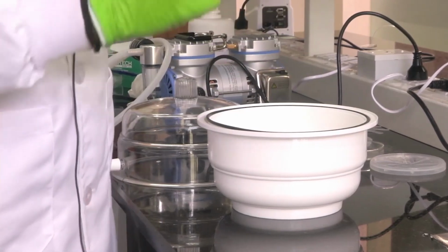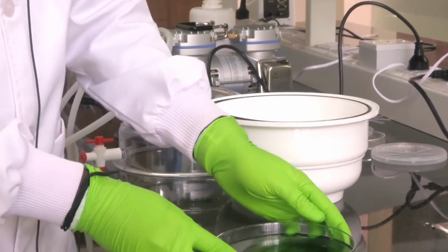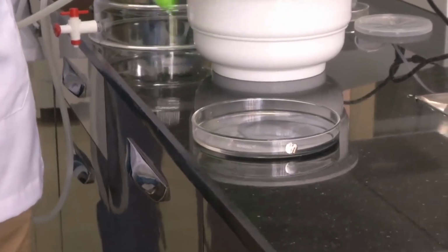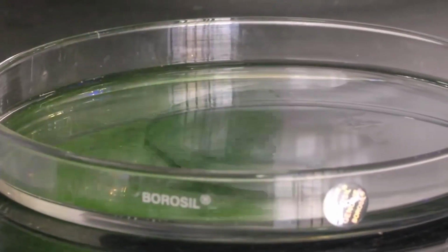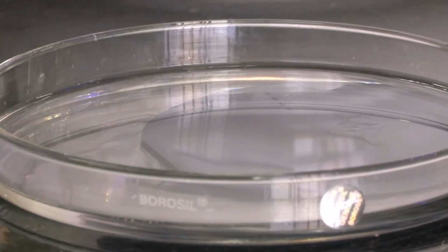So we have this much thick layer of PDMS on top of the silicon master. Because it is so clear now, you will not be able to even make out that there is a liquid on top of the master. But actually the PDMS curing agent mix is there on top of it. Okay. Now the next step is to cure it.